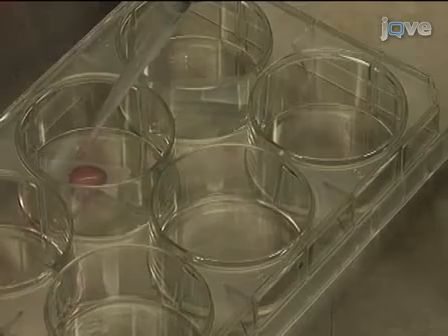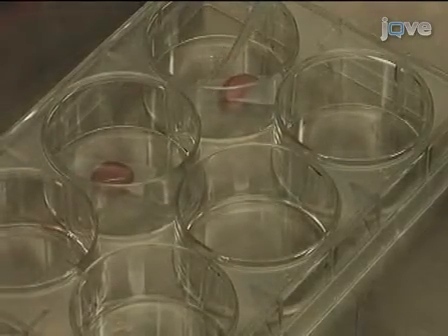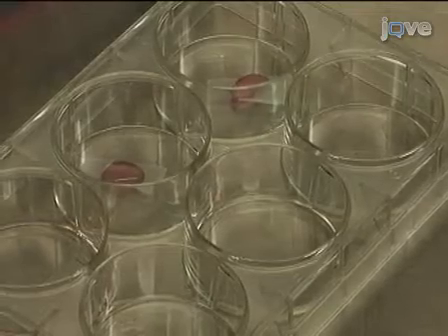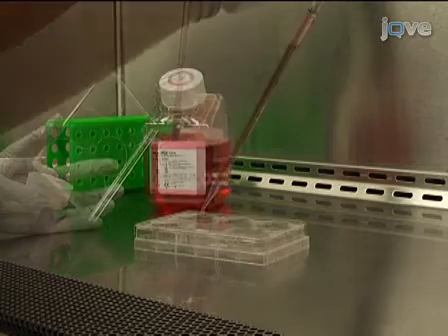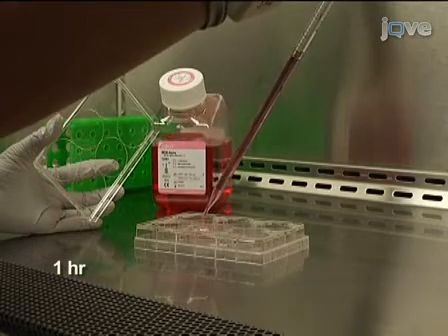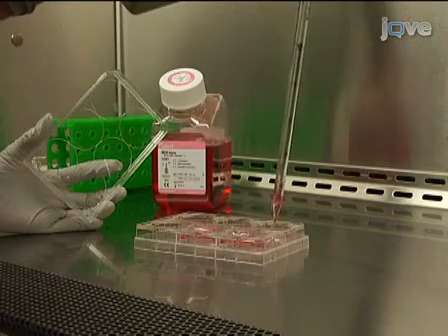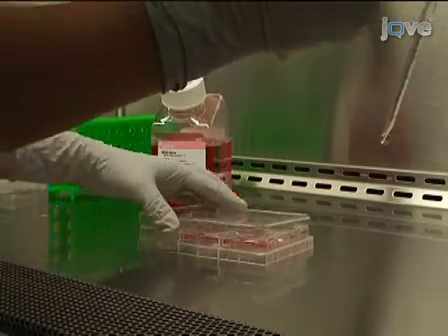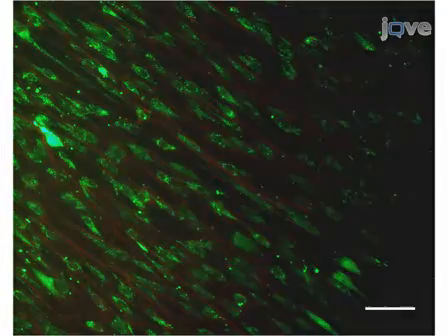Perform standard cell culture and prepare a concentrated cell suspension at the desired cell density. For example, use 100 microliters of cell suspension for a 22 by 22 millimeter coverslip. Place in the incubator for 1 hour. Add the appropriate amount of cell culture media to each well and place the scaffolds back into the incubator. Stain the cells using a commercially available Live/Dead kit from Invitrogen to visualize the cells and fibers using a fluorescent microscope equipped with filters for TRITC and FITC.